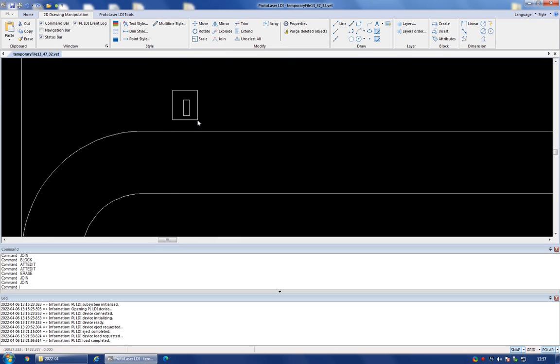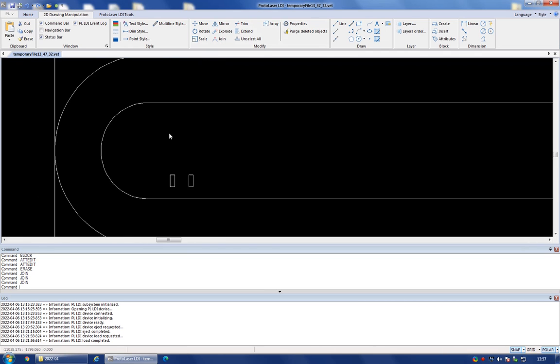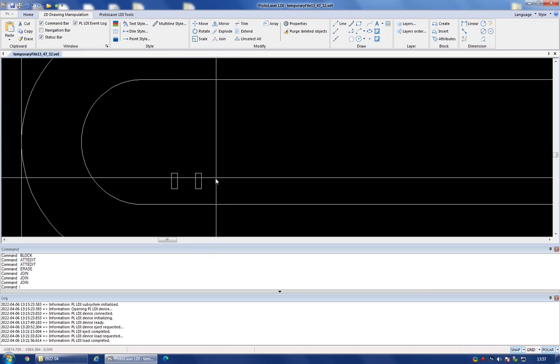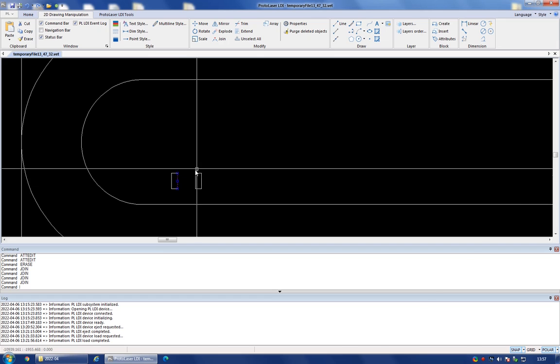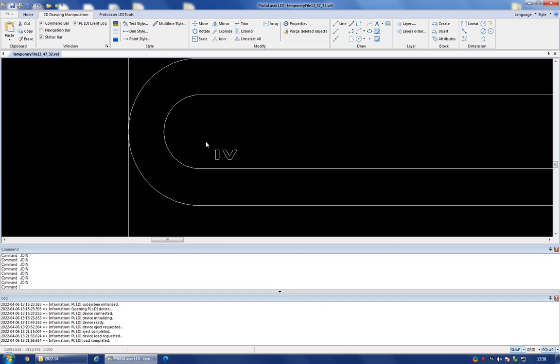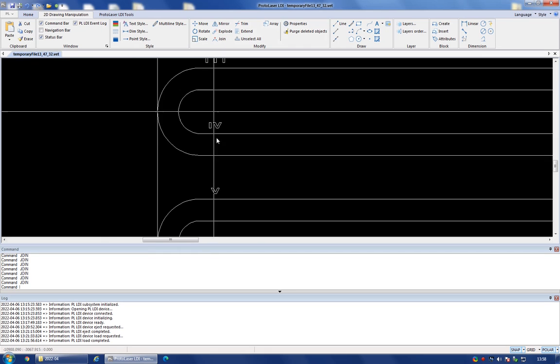So if I select this, I can hit the join button, and this will now be a single enclosed shape. But if I were to do the same thing on these two shapes, you can see that these are separate shapes. So if I select them both and I hit the join button, only one of the two will be joined, whereas the other one will still be separate. So I have to join each of these individually, and I have to do this for all the shapes that I've put in my drawing. Okay, so I'm going to go ahead and do that. It's a slightly tedious process the first time you do it, but hopefully you only have to do it once.